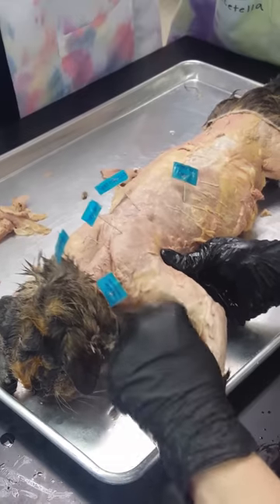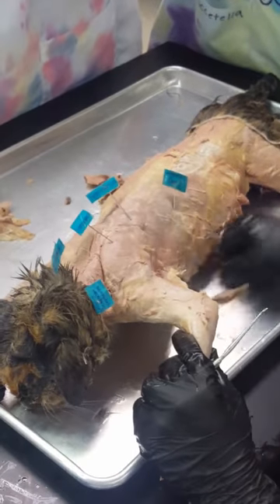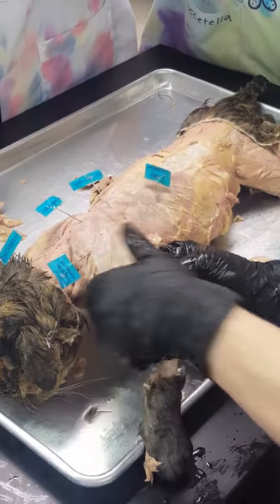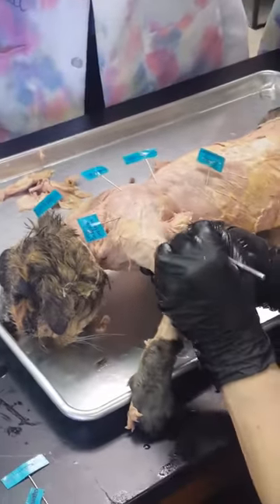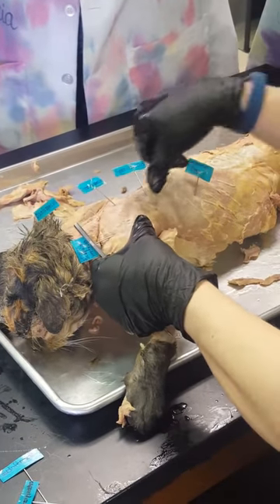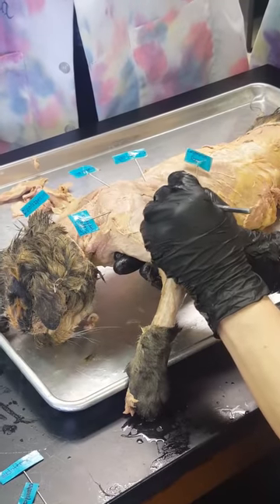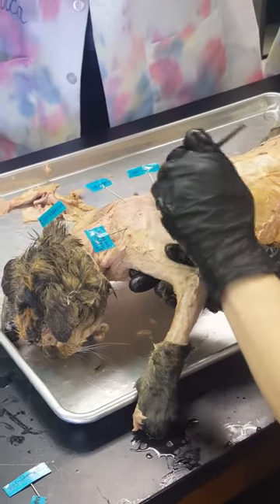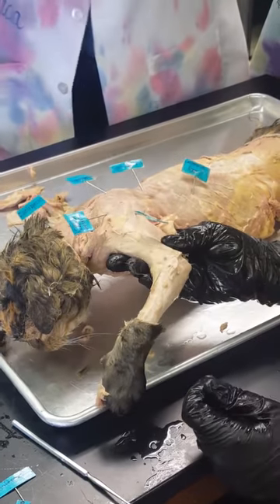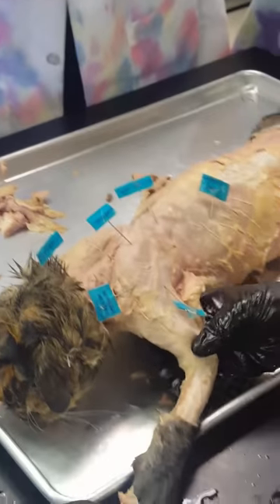Your delts are going to be in the arm, so you'll need to clean off some more goo to see them. Once you get the goo out of the way, the first one I uncovered I call the 'fingerprint' — you can see how the bra strap goes right into it. It's called spinodelt, and what's cool is that spinotrapezius ends right there and spinodelt begins, almost touching — like Michelangelo's painting of Adam and God. Spinodeltoid is the fingerprint, positioned right next to spinotrapezius.